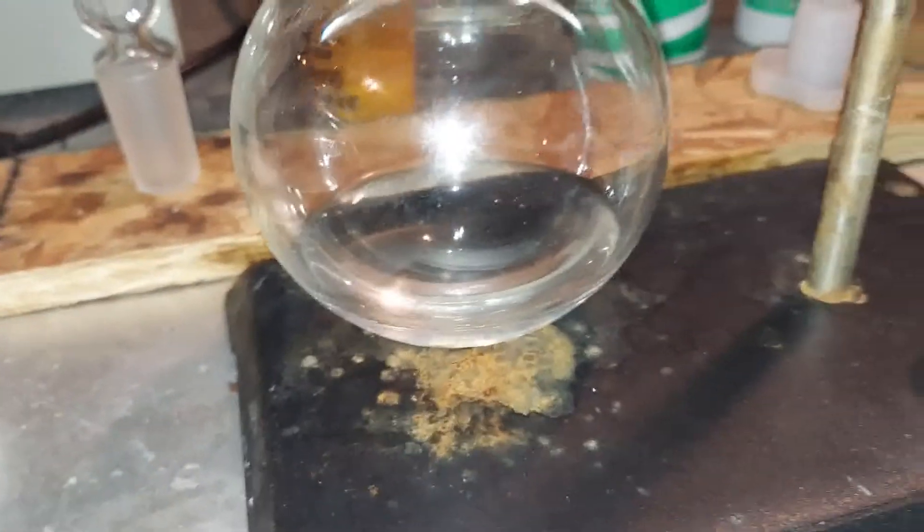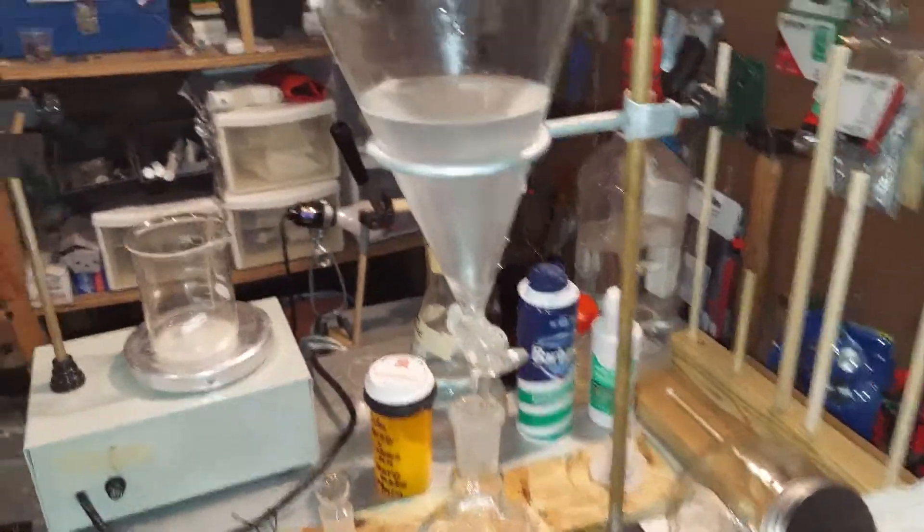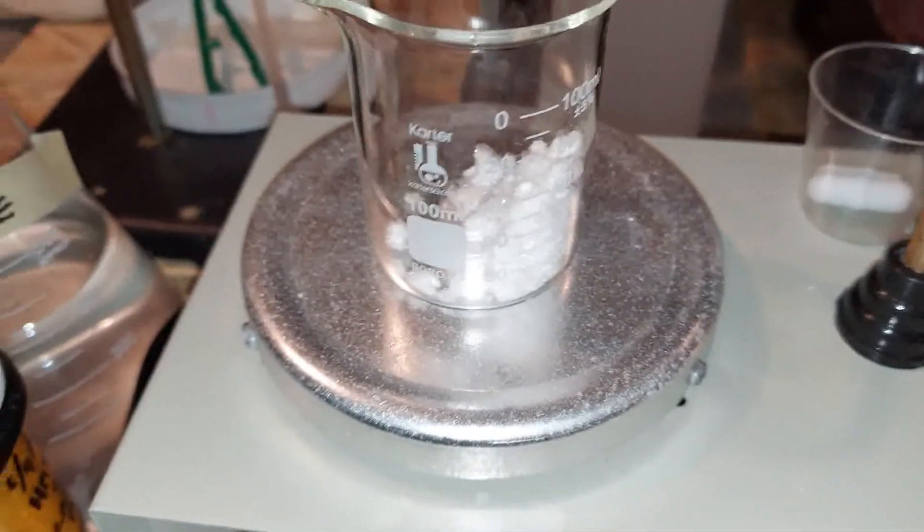Okay, and then we have our almost pure chloroform. It's still got a little water in it, like I said earlier. We're going to distill it, and I'll dispose of the salt solution there.